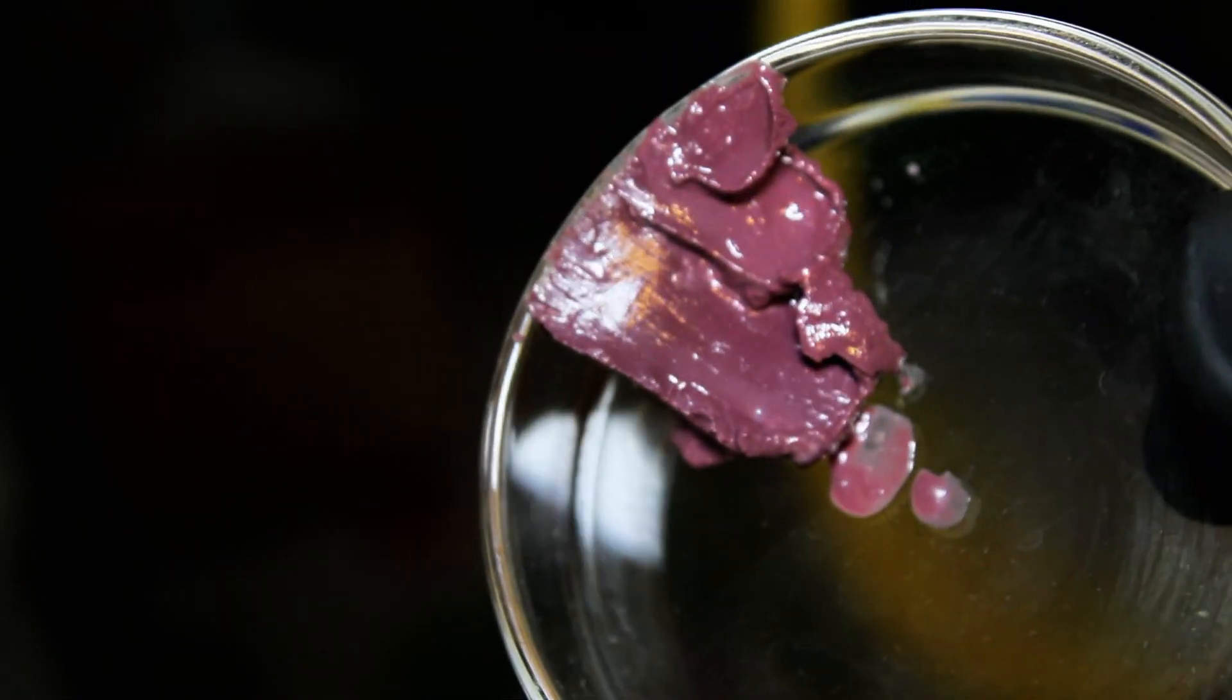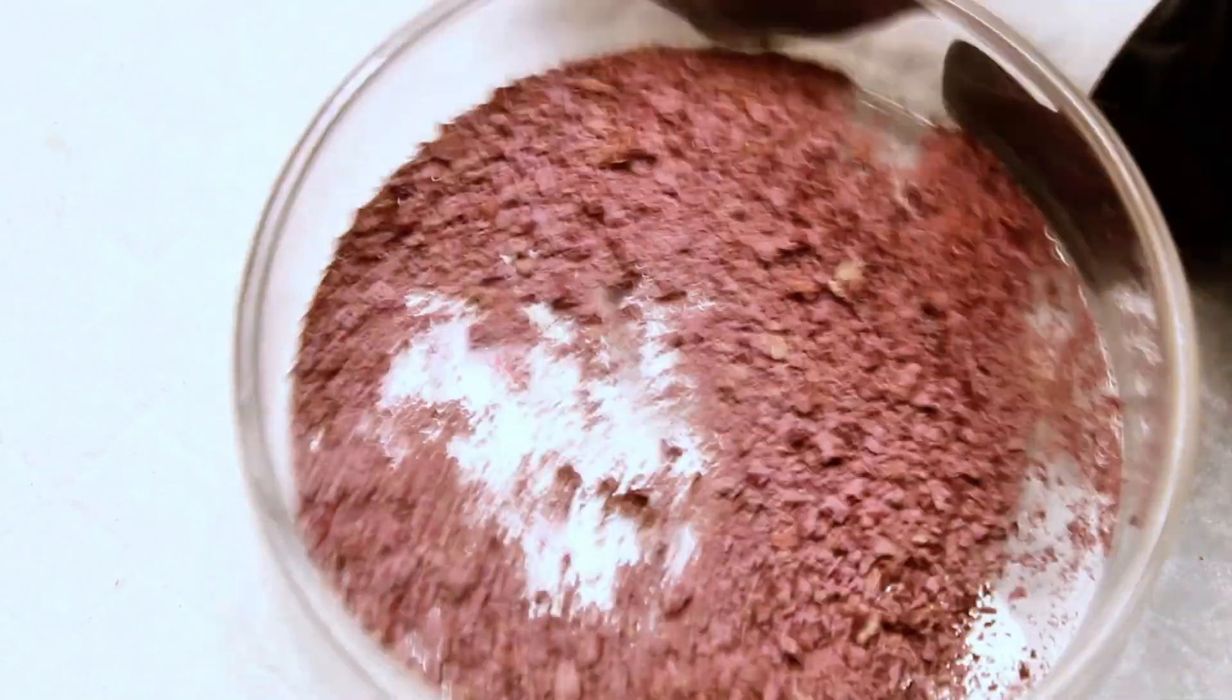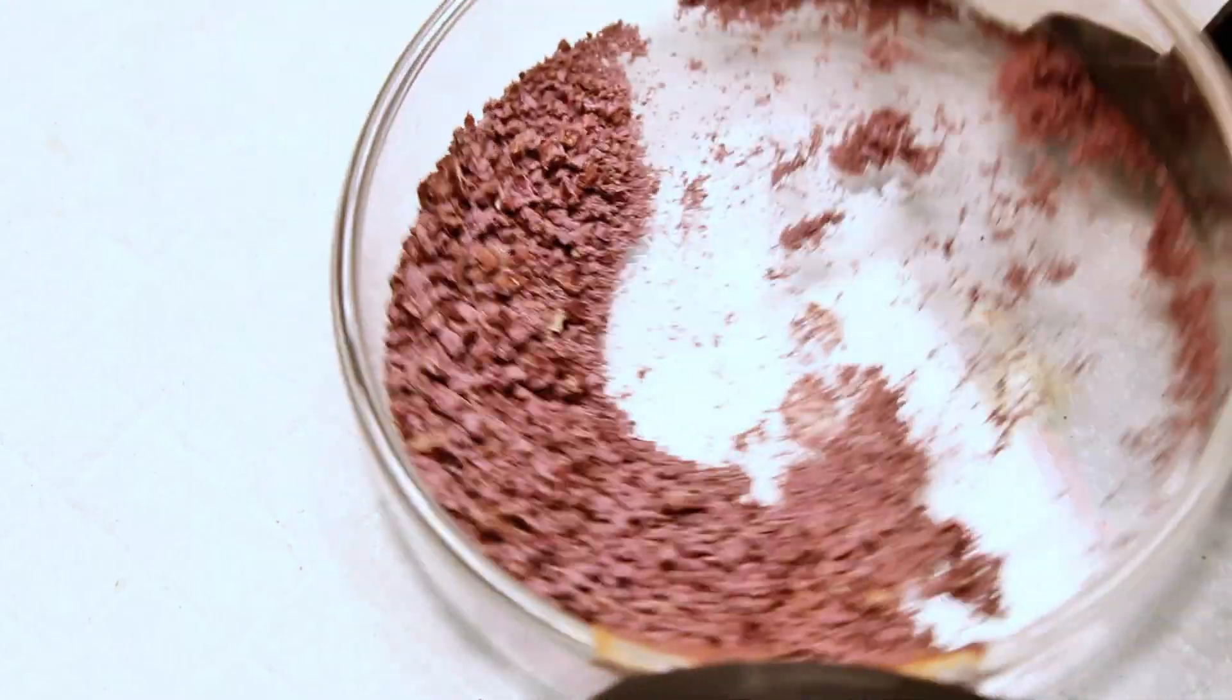Anyway, these represent the only three stable inorganic iron oxidation states I've been able to isolate, but before I end this video, I thought it would be cool to show two more reactions you can do with iron.